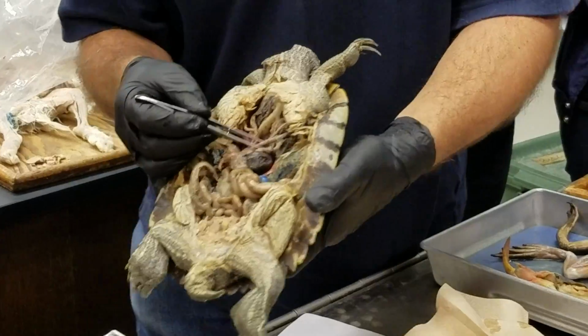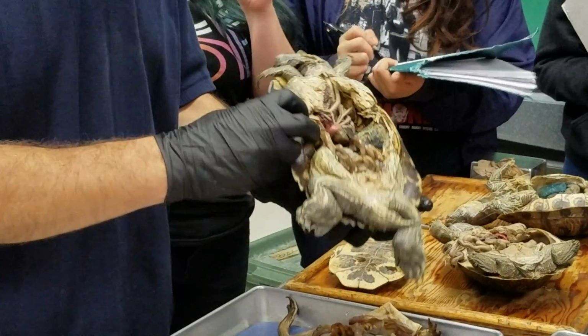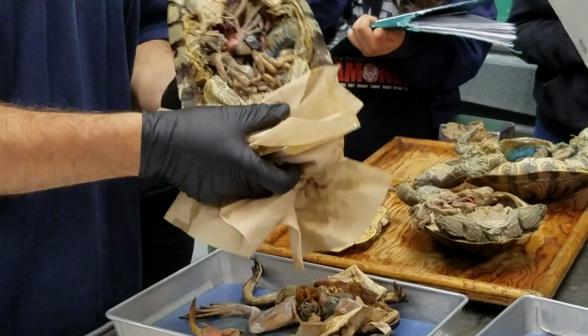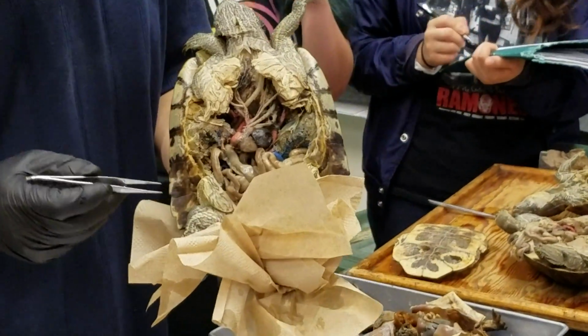Still dripping. Yeah, don't want to drip. It's just a drippy guy. It's funny though, because it wasn't really dripping in the last group. What I'm doing differently is just holding some towels under it. How's that? When you eat your burrito, you know you got it.